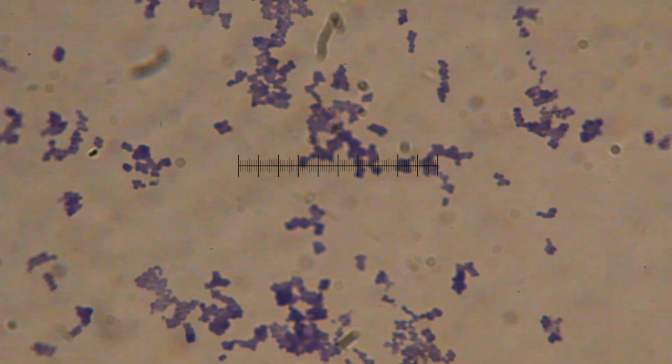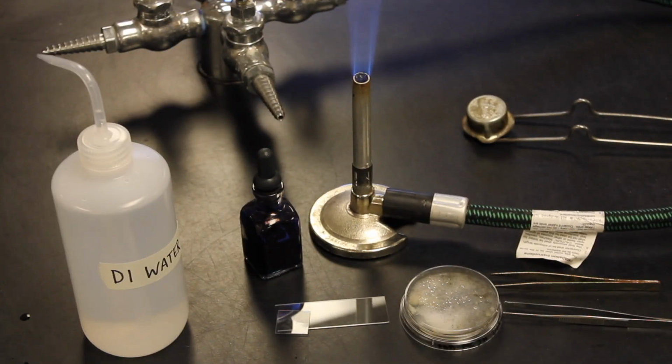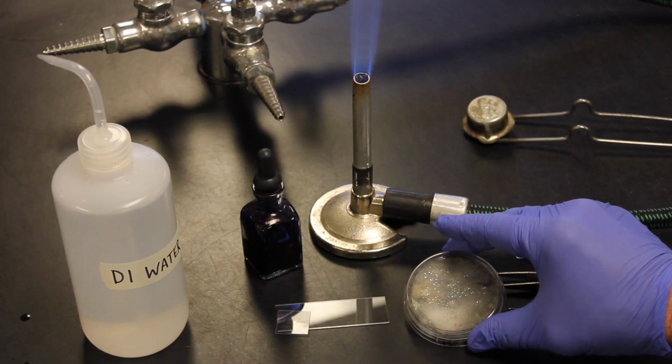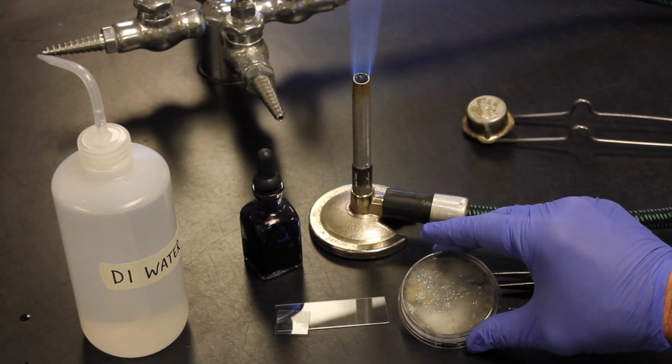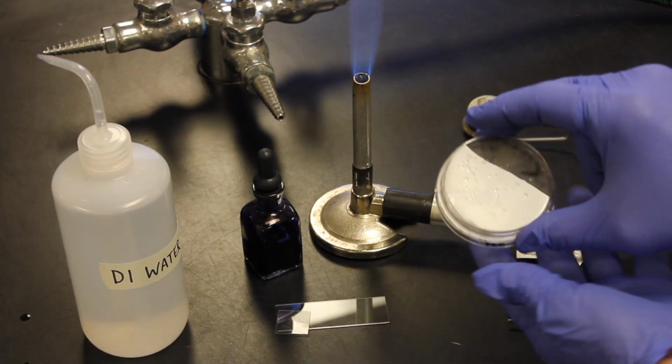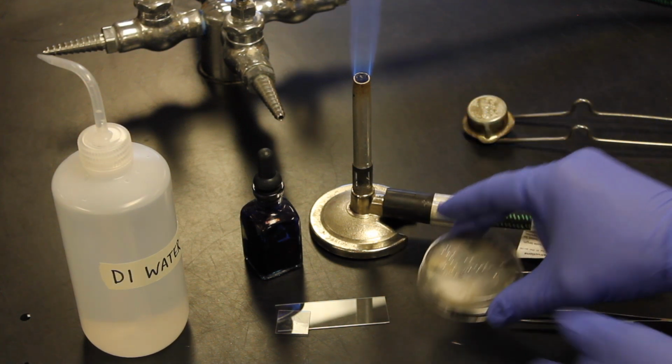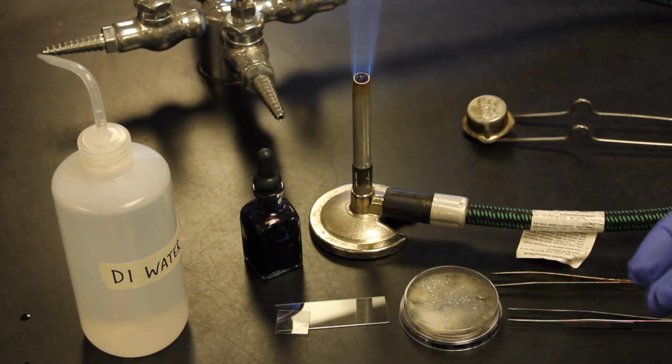Alright, there we go. Alright, so now we're ready to work with our other contact plate. This is the PDA plate, which favors fungus. This was also put on the same computer keyboard, and we can see here that instead of bacteria, we have a lot of fungal growth on there. Right? Funguses are fuzzy, bacteria then are more slimy.